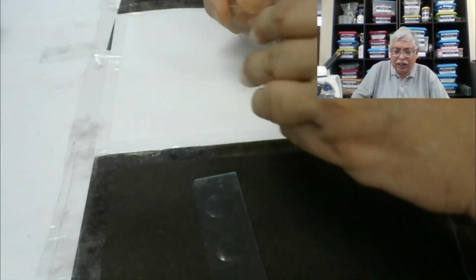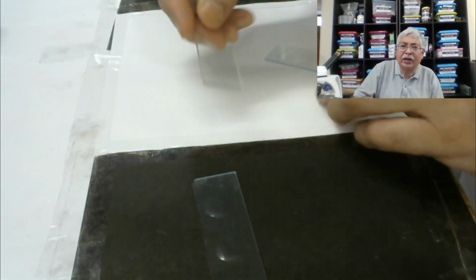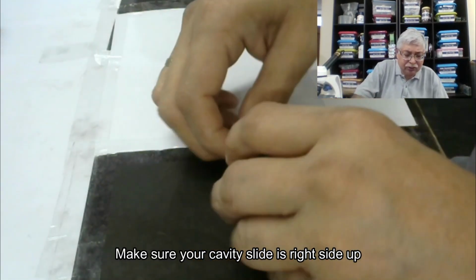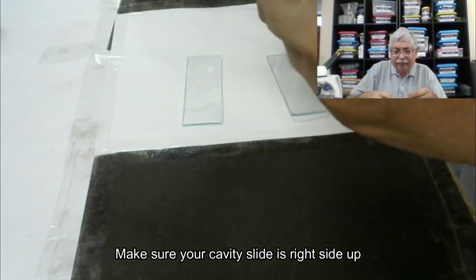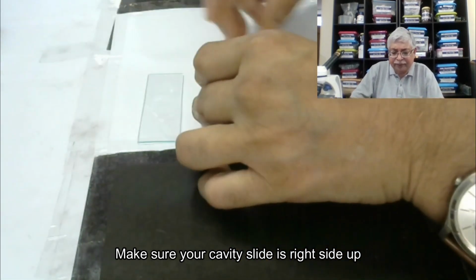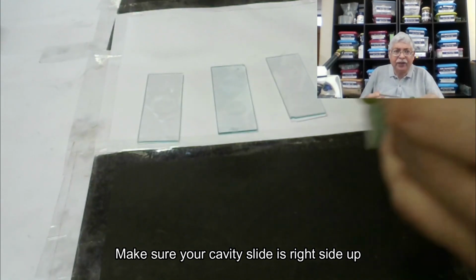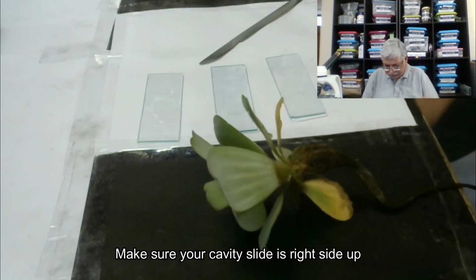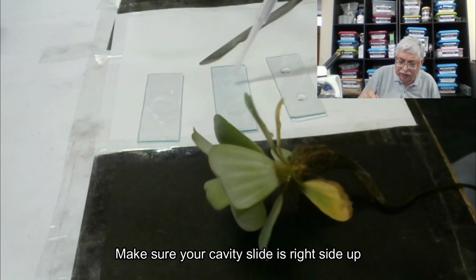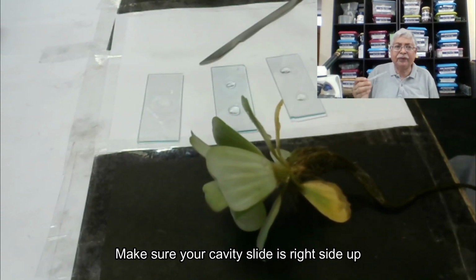So here we are. This slide is known as a cavity slide. There are some concavities so that we can keep the thing. We just need to check which side is the concavity, please. So here we will need a scalpel. With the help of a dropper, we will give a drop of water in all. We keep the dropper ready.